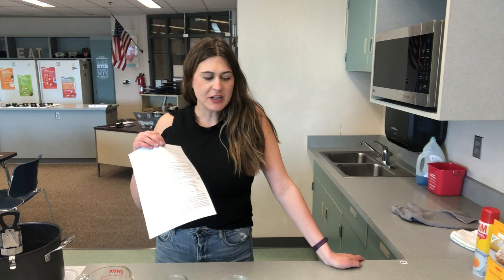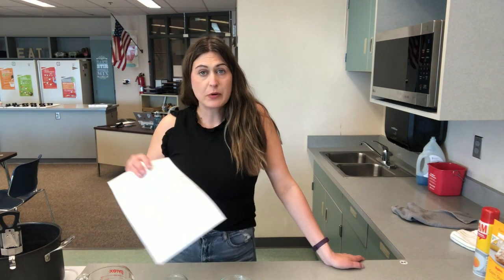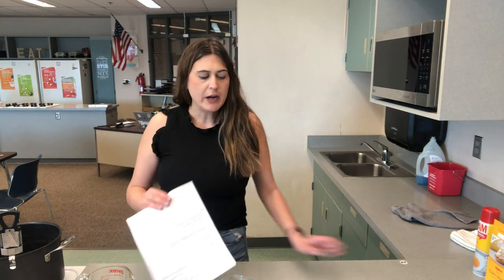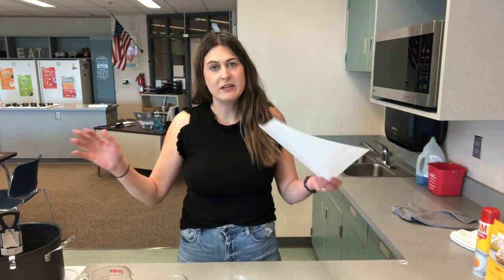When you're in person, this is just to help you get set up in your station, and this is also for those that are distant, so you can see the process and then watch the end of the video to see the visual product and how it changes and kind of see the lapse of time. So the beginning part is for everybody, and then keep watching if you're distance students.